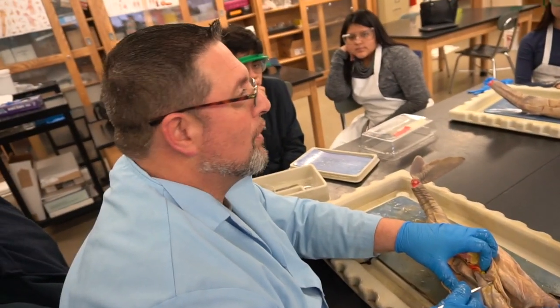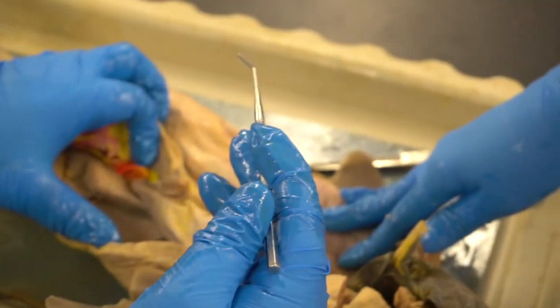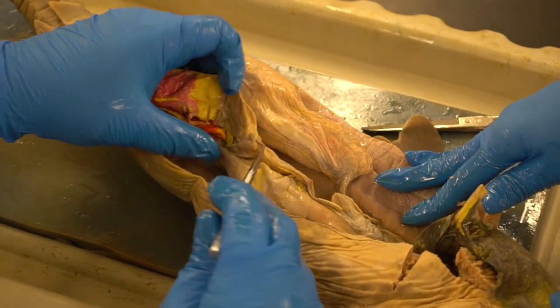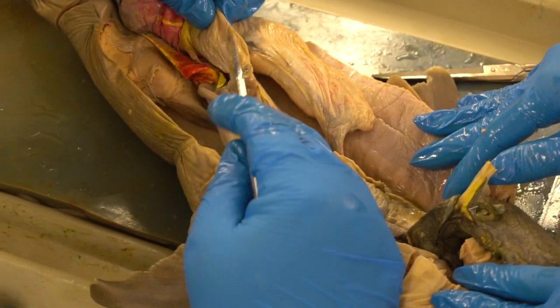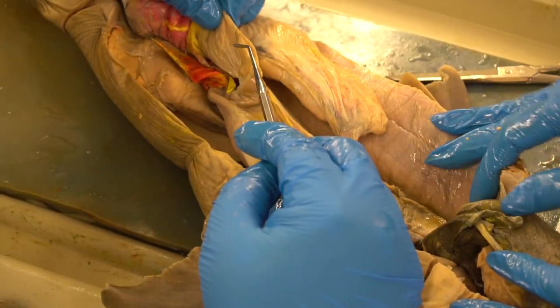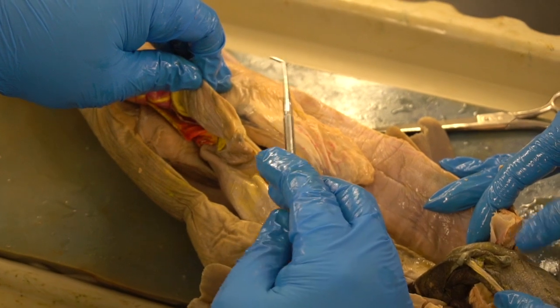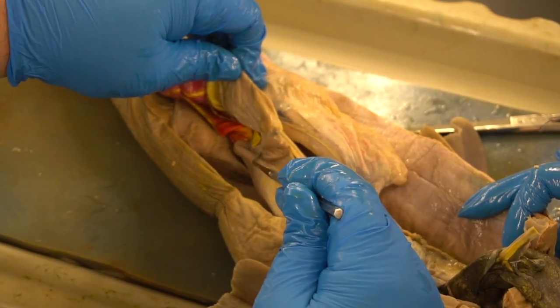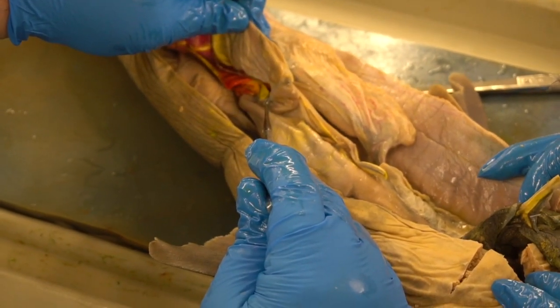Okay, that liquid is called chyme, C-H-Y-M-E. So from the point of the stomach down, it's a fluid. Okay, and then the job of the body is to take back as much of that fluid into it to maintain hydration. So here, enzymes from the bile coming in from the liver, and also fluids from the pancreas, which kind of looks like a piece of gum stuck onto this. This is the pancreas. The pancreas makes pancreatic enzymes, things that break down fats, lipases, things that help break down other carbohydrates. These are all here, and this also dumps into the duodenum. So you got bile salts, you got pancreatic juices, all flowing into this area, the duodenum. Okay, so it's a very popular area.